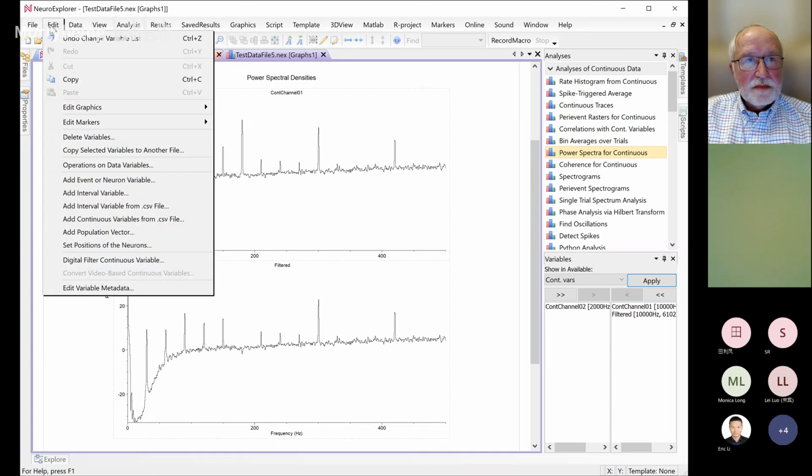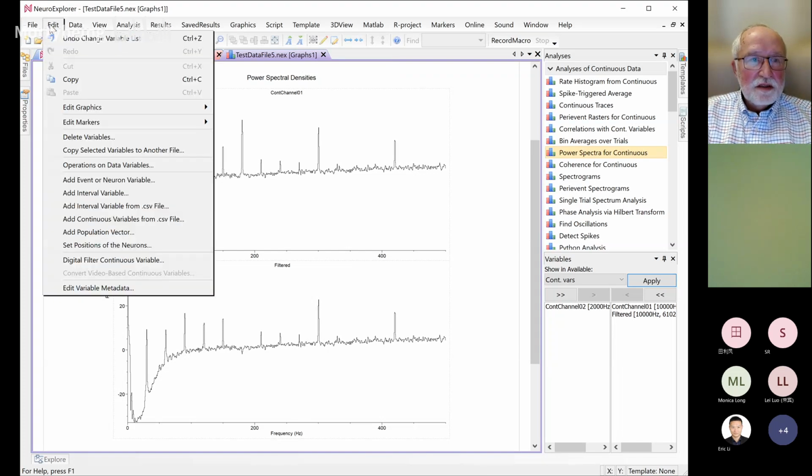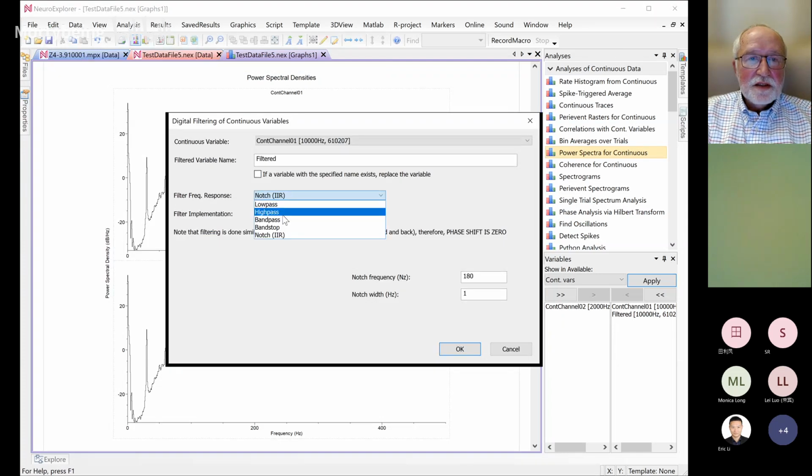To get rid of 50 hertz, we need to open the data and choose analyze power spectrum for continuous. No, you don't have to analyze. If you want, this is just for visualization. This analysis is not used in the cleaning. So if you want to clean 50 hertz, you go to edit, digital filter, and select the last filter, notch. And specify 50 hertz here, and then the name of the variable. So this works for one channel only, but it could all be automated with a little scripting. So this is how you do this for a single channel.